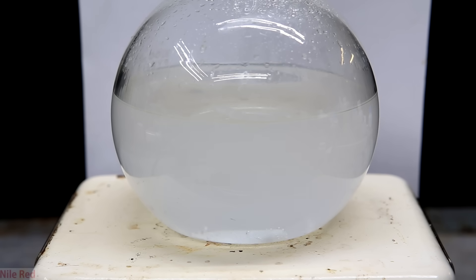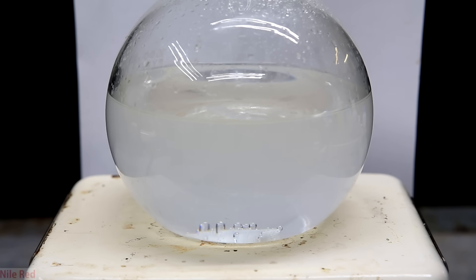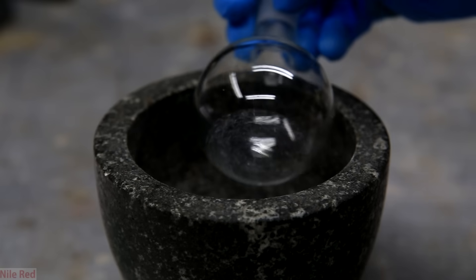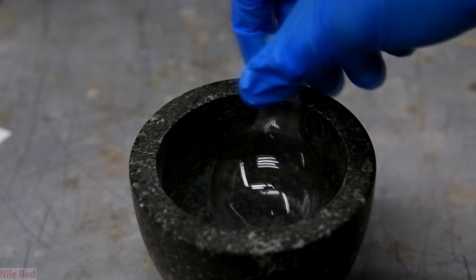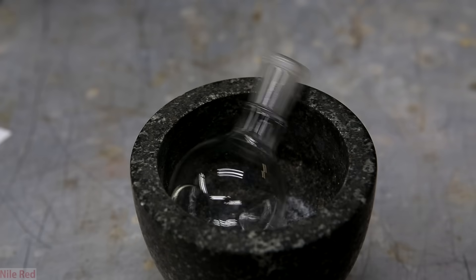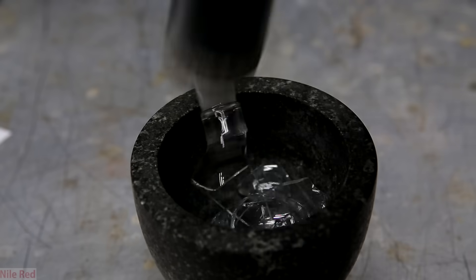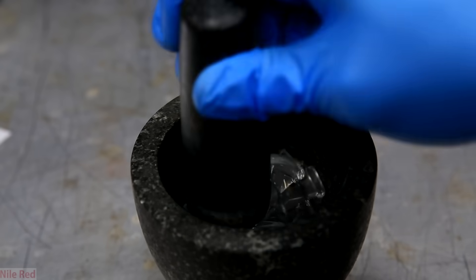We keep stirring and eventually we'll have a clear solution with a lot of bubbling. The bubbles are a little bit of CO2, but a lot of it is actually peroxide breaking down into water and oxygen gas. The next step is to boil the acid to concentrate it and get rid of excess peroxide. For this we'll need some boiling chips — I used broken glass, pulling out an already damaged round-bottom flask and sacrificing it for the greater good. Once crushed into moderately sized pieces, I was ready to move on.